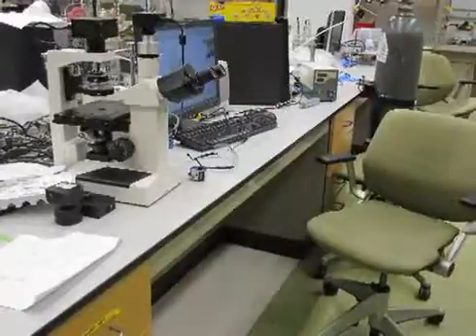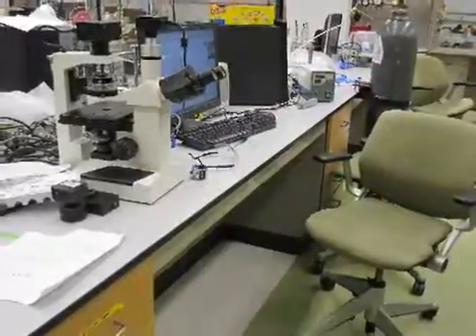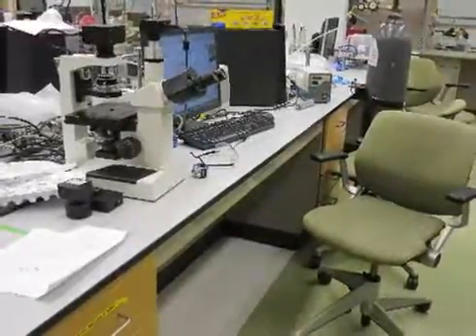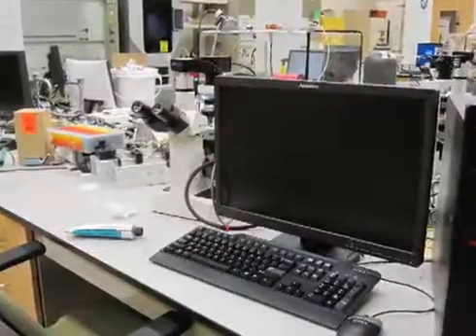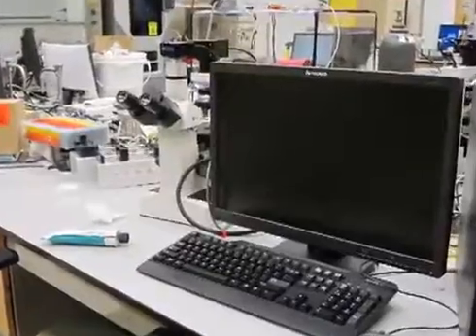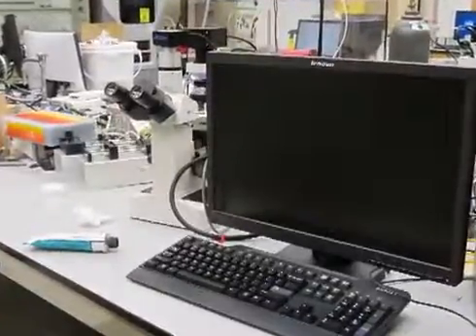Here in the biomedical engineering laboratory, you can find an XDS-1 inverted microscope at each station with a working computer. Locate one of the microscopes in the laboratory and follow these instructions to set the microscope in bright field.